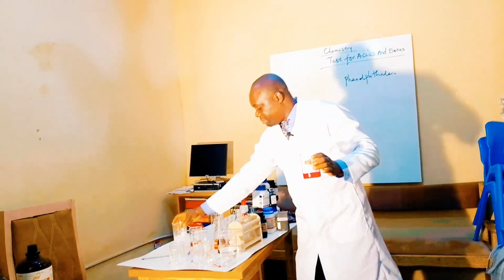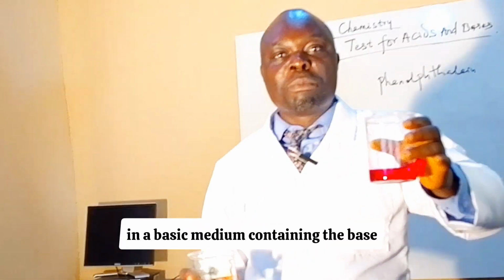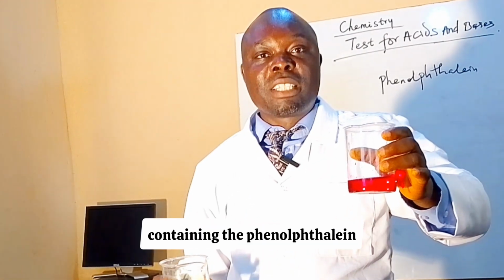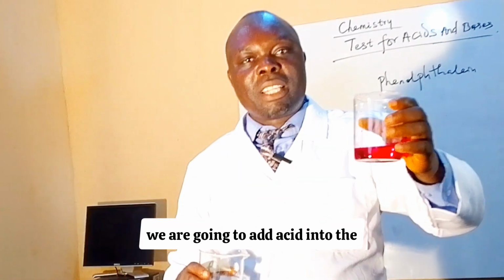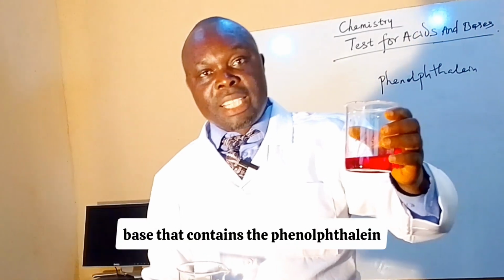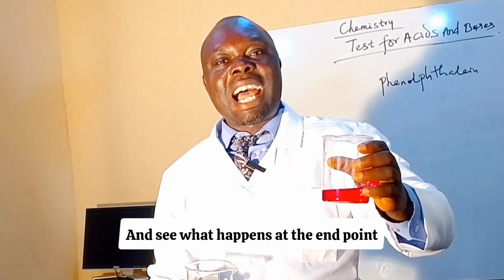What happens when we continue to add acid in a basic medium containing the base and the phenolphthalein? We are going to add acid into the base that contains the phenolphthalein and see what happens at the end point.